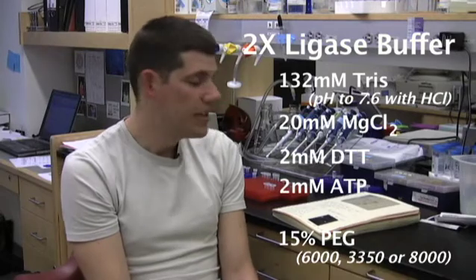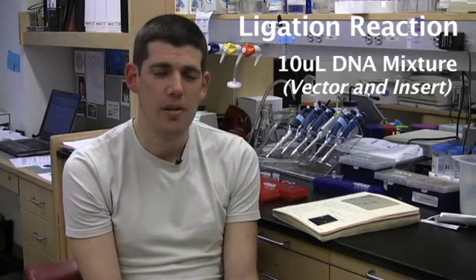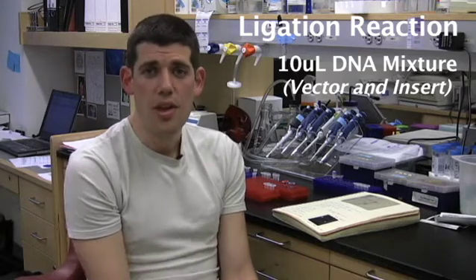The buffer is a 2X buffer, which means you put together your backbone and insert, preferably below 10 microliters, and then match that amount with the same amount of buffer.